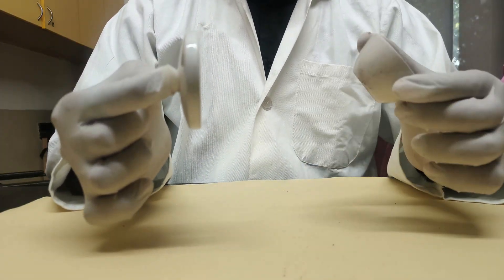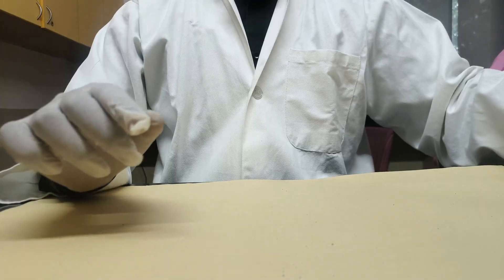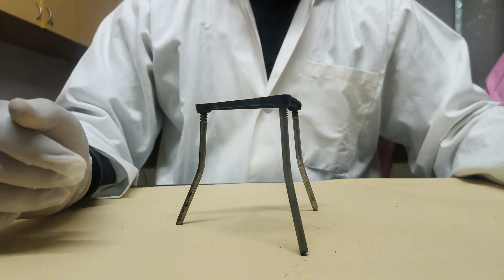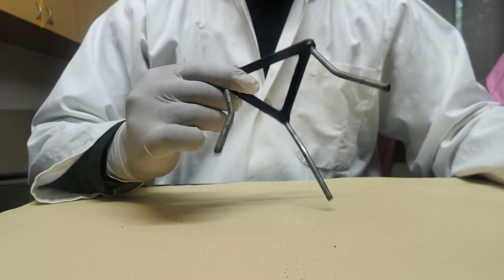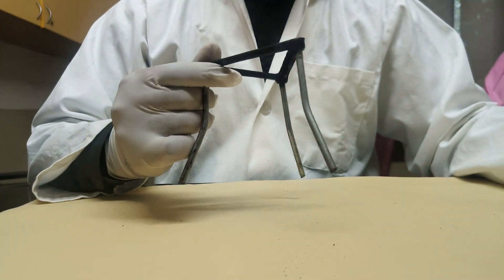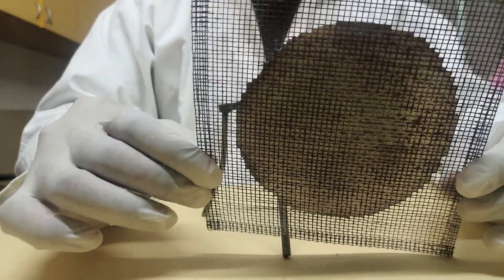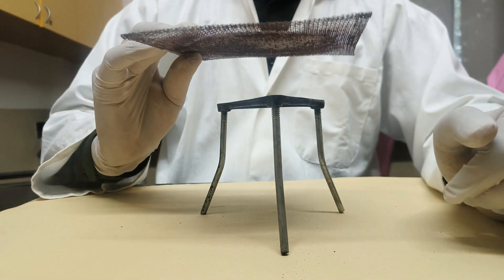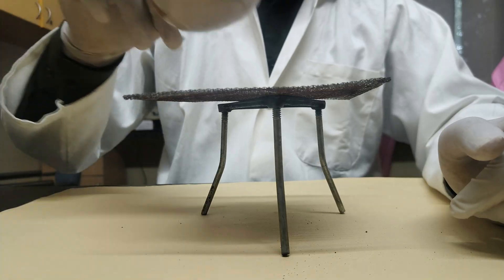Next is the tripod stand. It has three legs, so it is known as a tripod stand. It is used with another apparatus called the wire gauze — a specially netted structure of wires that distributes heat in equal amounts. You can see in the image how it is used.